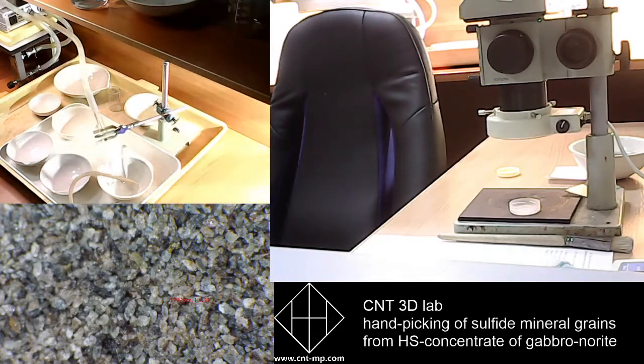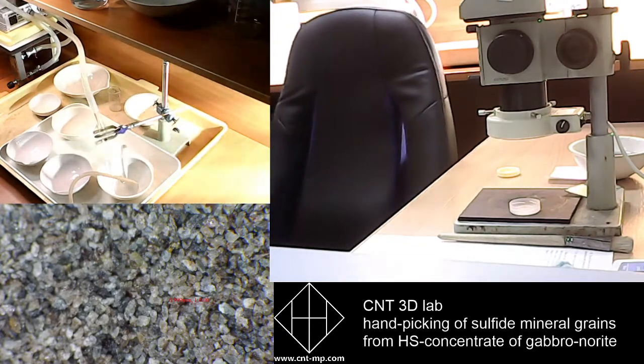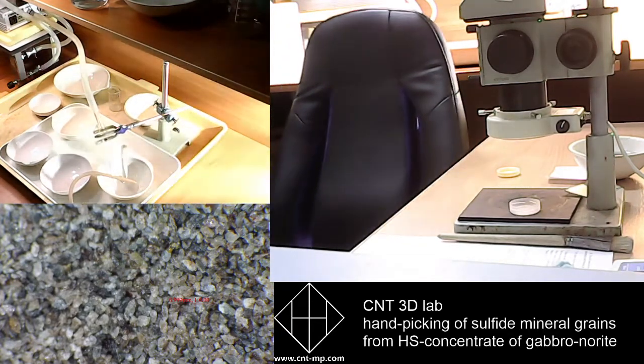We always do first EPD Spark 2, second we perform EPD Spark 10. After that we do wet sieving, hydro separation, and sometimes ultrasonic sedimentation.